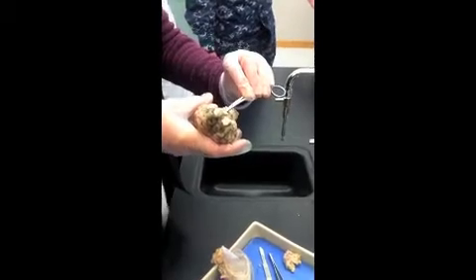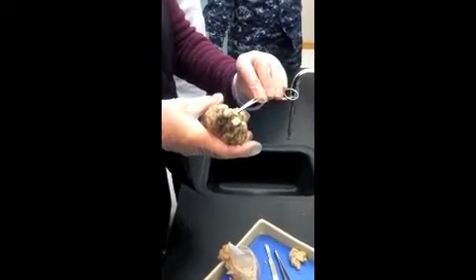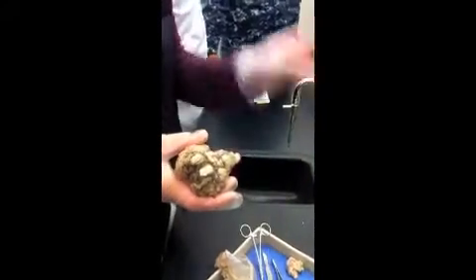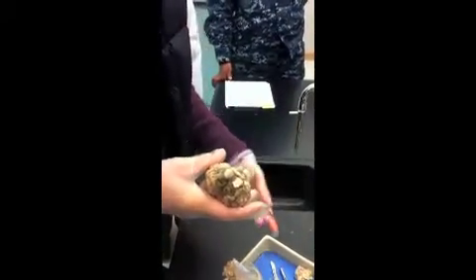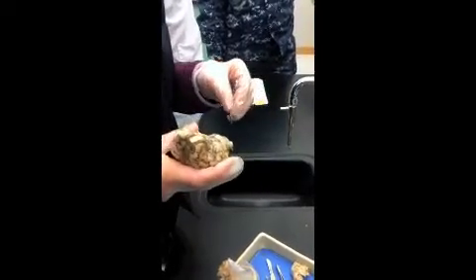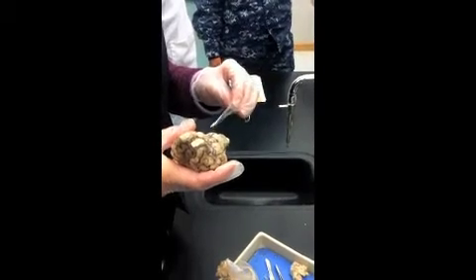The thalamus is a very important relay center. All sensory information coming into the brain makes a stop at the thalamus, and then the thalamus sends it out to the appropriate places in the cerebrum. Beneath the diencephalon, we have the midbrain, and this little bulge right here is called the pons, which means bridge.